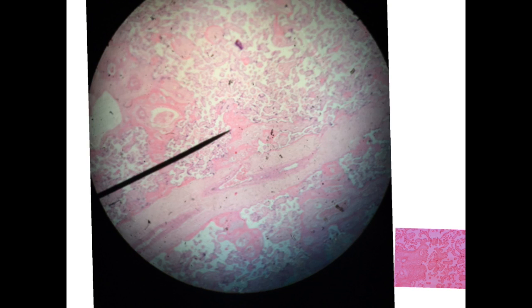These are different sections of the chorionic villi. Some are small as we see, and some are bigger, and they contain the blood capillaries. Also, you'll see another one here. These are the chorionic villi, and of course you notice that the chorionic villi are formed of blood vessels and cells. It is not empty.